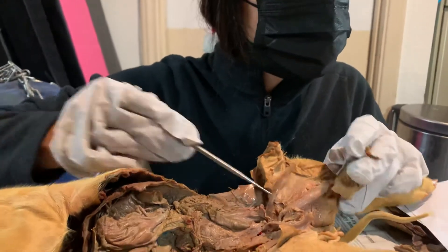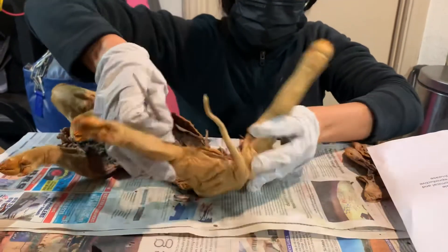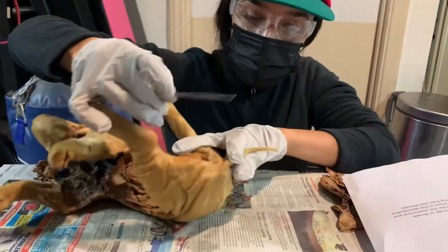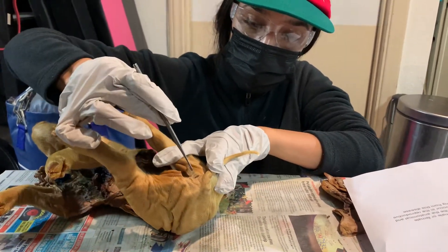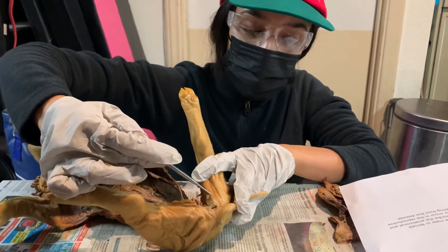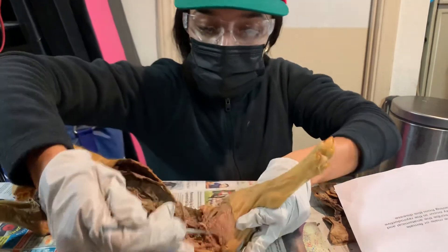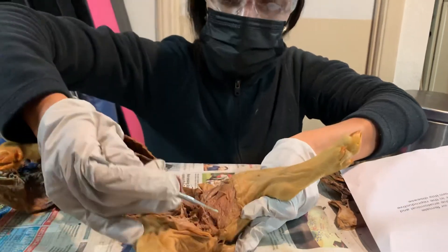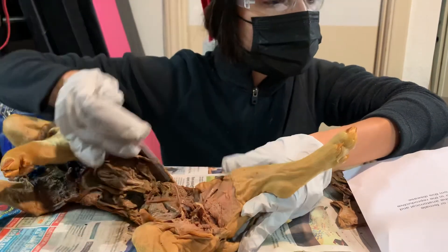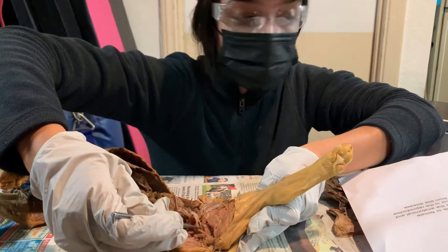Now I'm going to show you the urogenital opening. The urogenital opening is right here, the urogenital papilla is right here, and the vaginal papilla is here. The vagina continues right here.